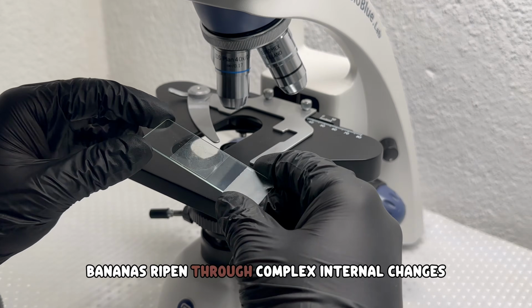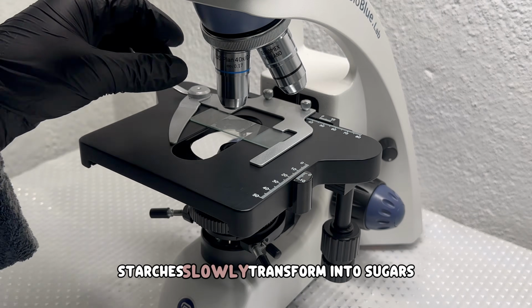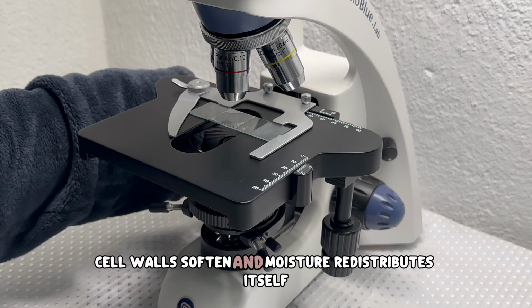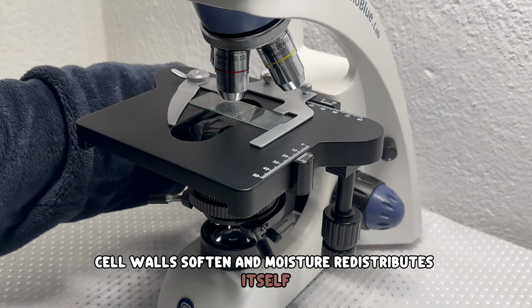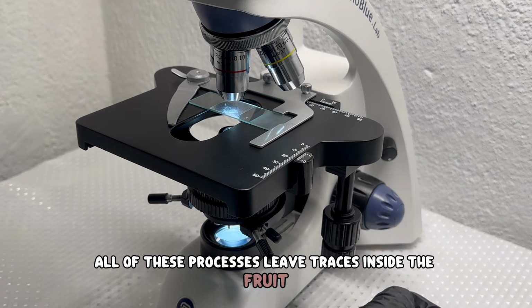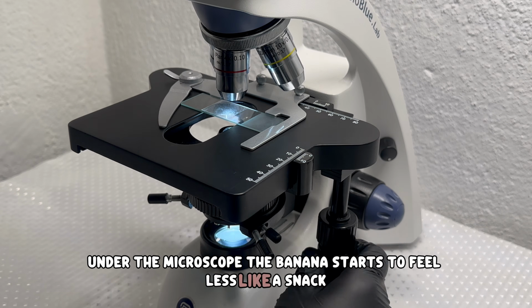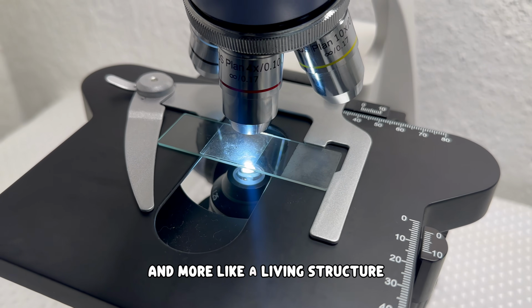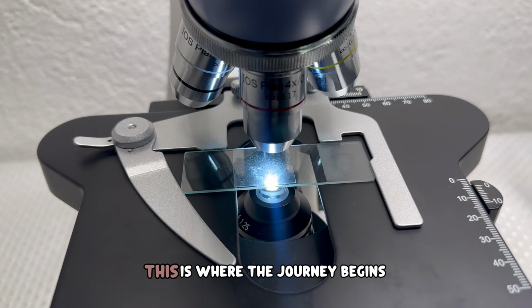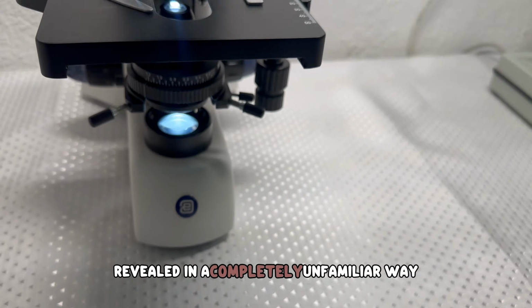Bananas ripen through complex internal changes. Starches slowly transform into sugars. Cell walls soften and moisture redistributes itself. All of these processes leave traces inside the fruit. Under the microscope, the banana starts to feel less like a snack and more like a living structure shaped by growth and ripening. This is where the journey begins, with a fruit everyone knows, revealed in a completely unfamiliar way.